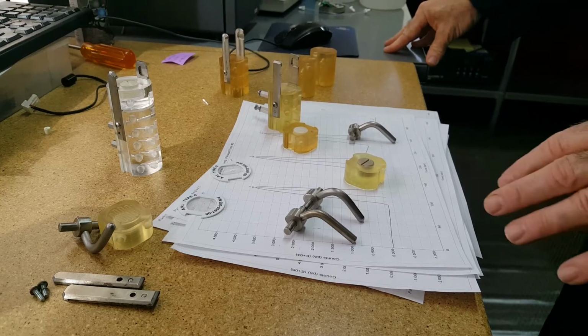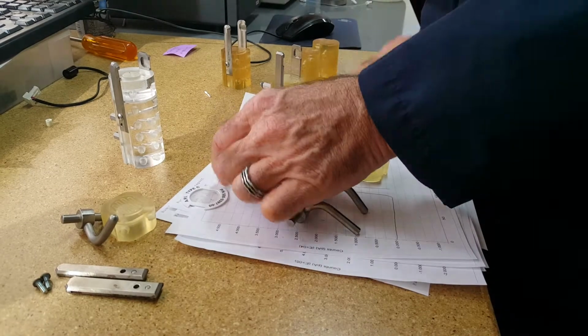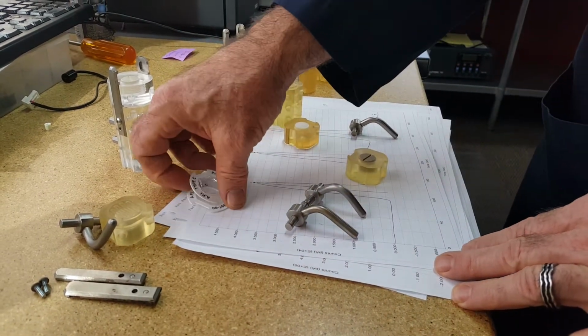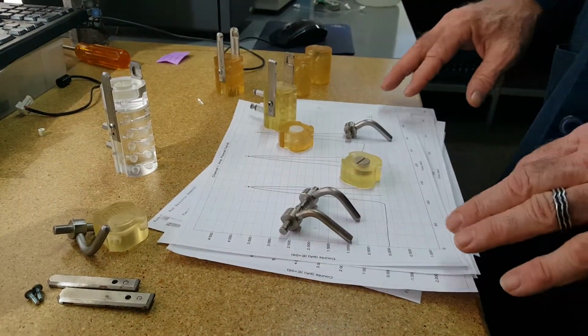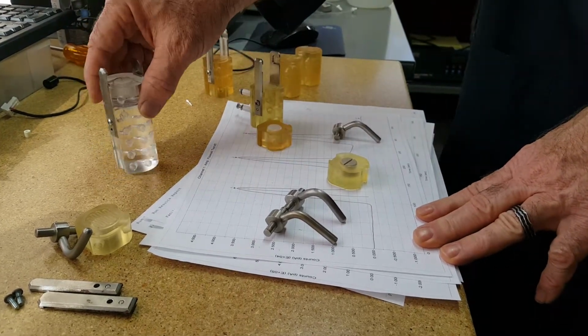Good morning, this is Ken Earl with EZkem, again in our production lab going over membrane modules. We just went over membranes and now we wanted to go a little bit more in detail into the different modules that we have for gas diffusion.